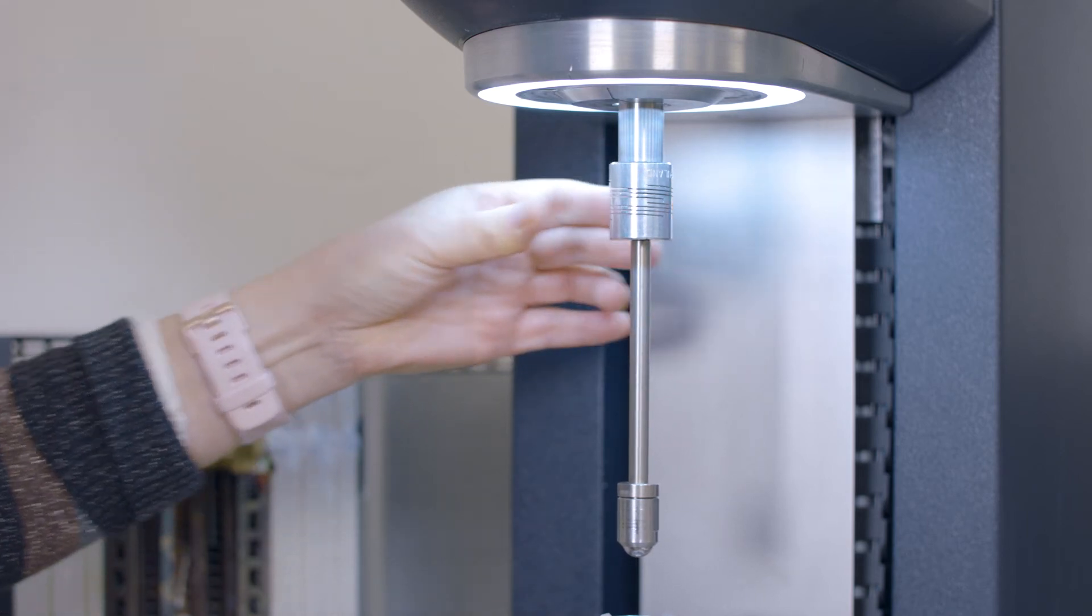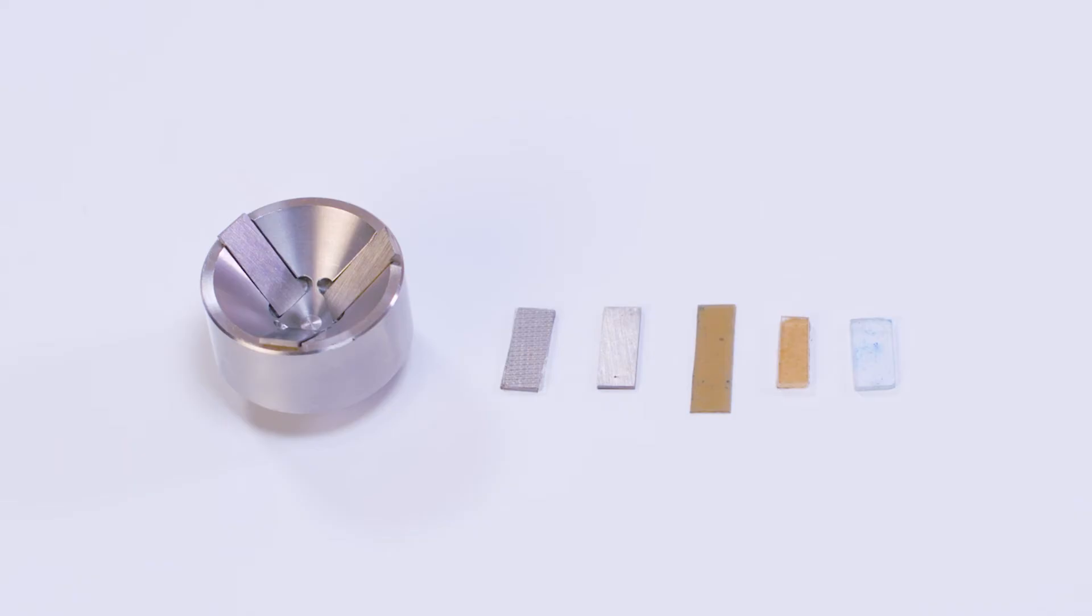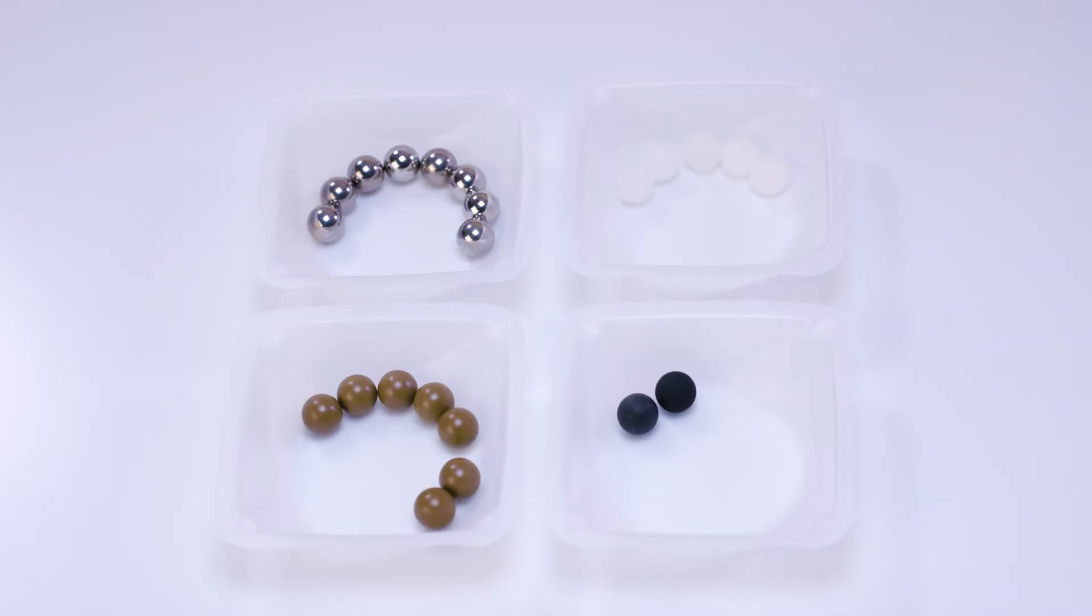TA Instruments provides the users with stainless steel balls and plates, but users can also use different types of balls and plates based on their test need.